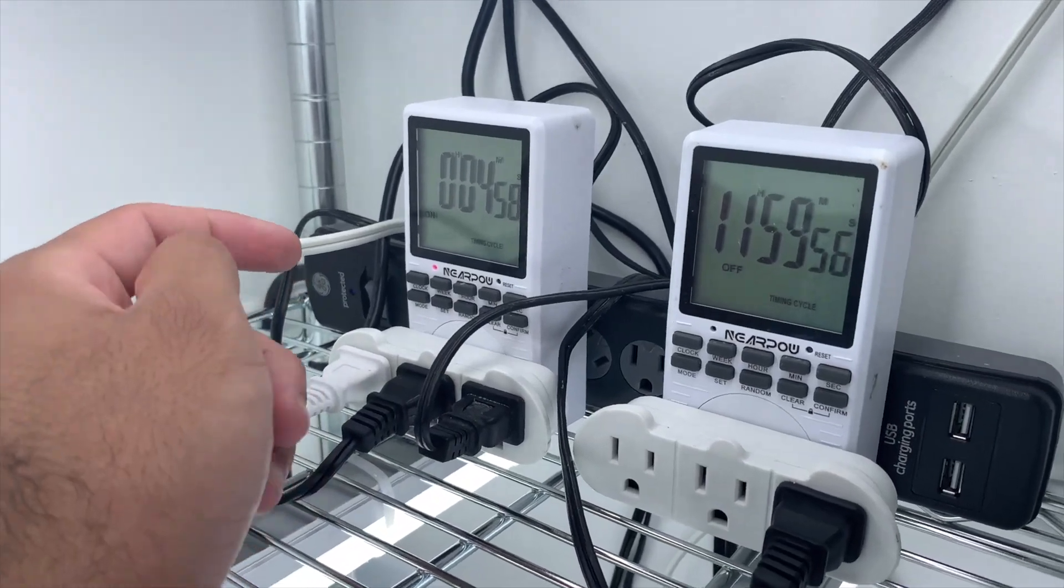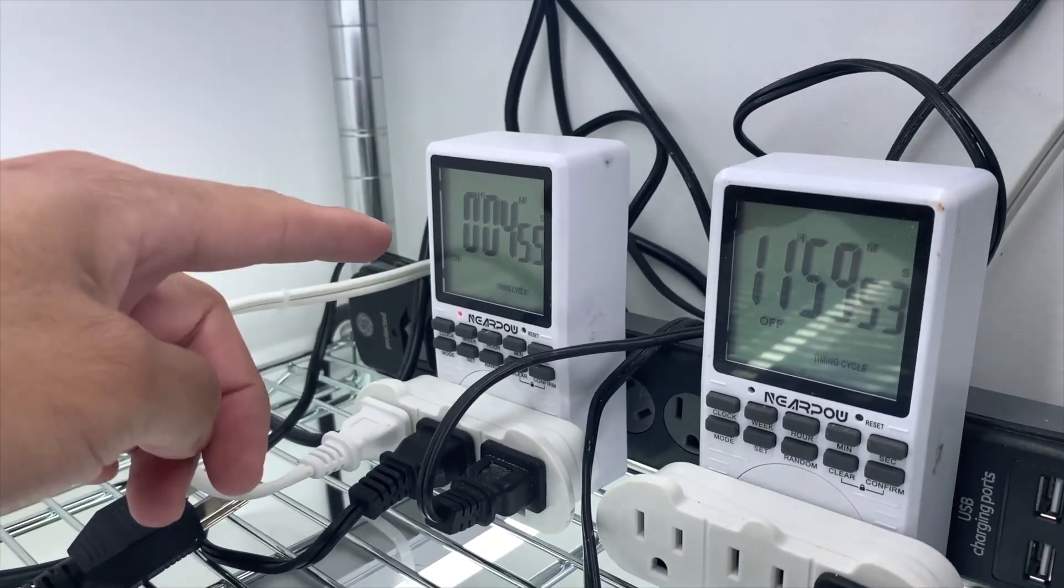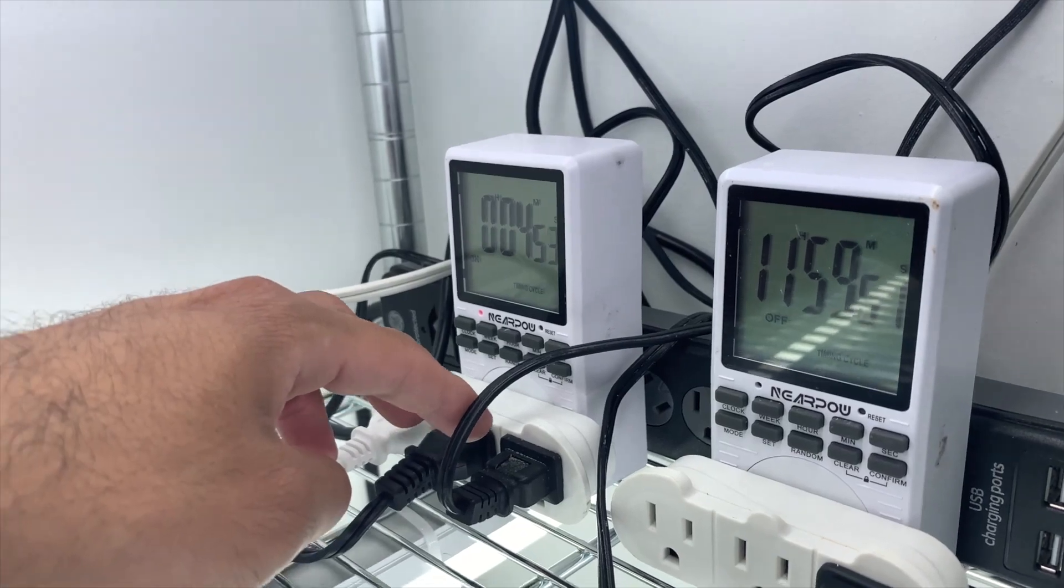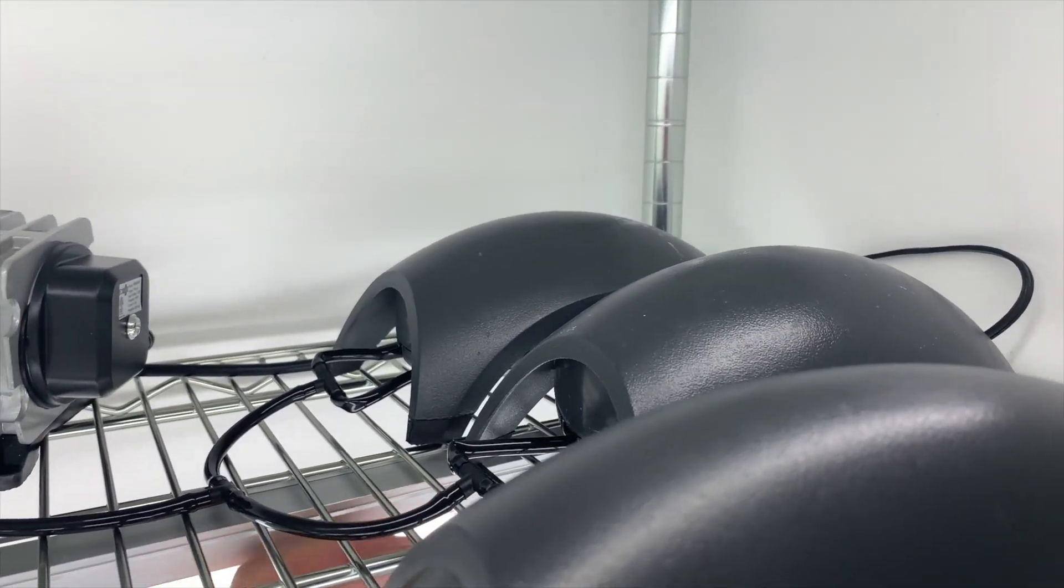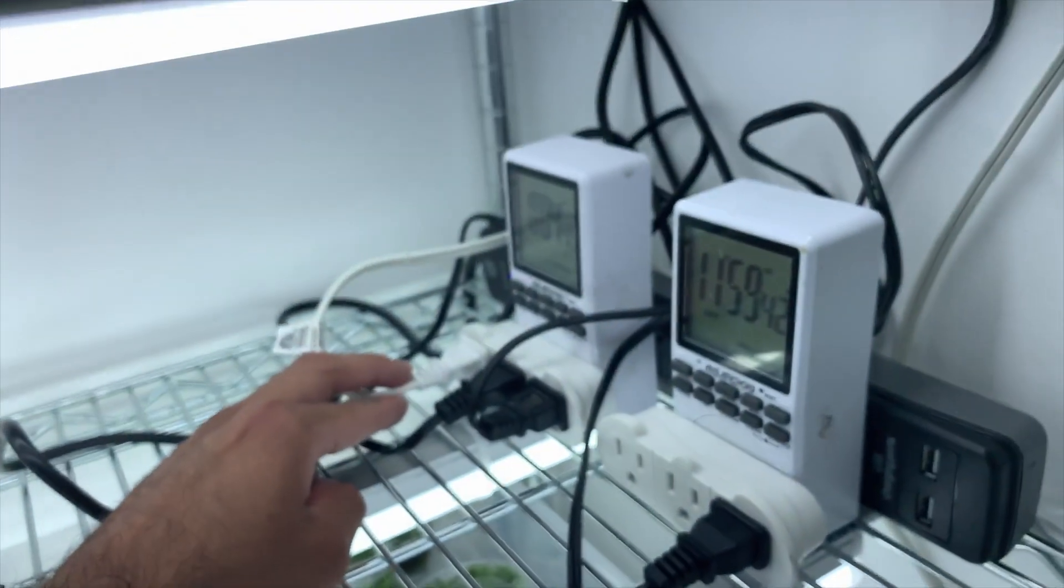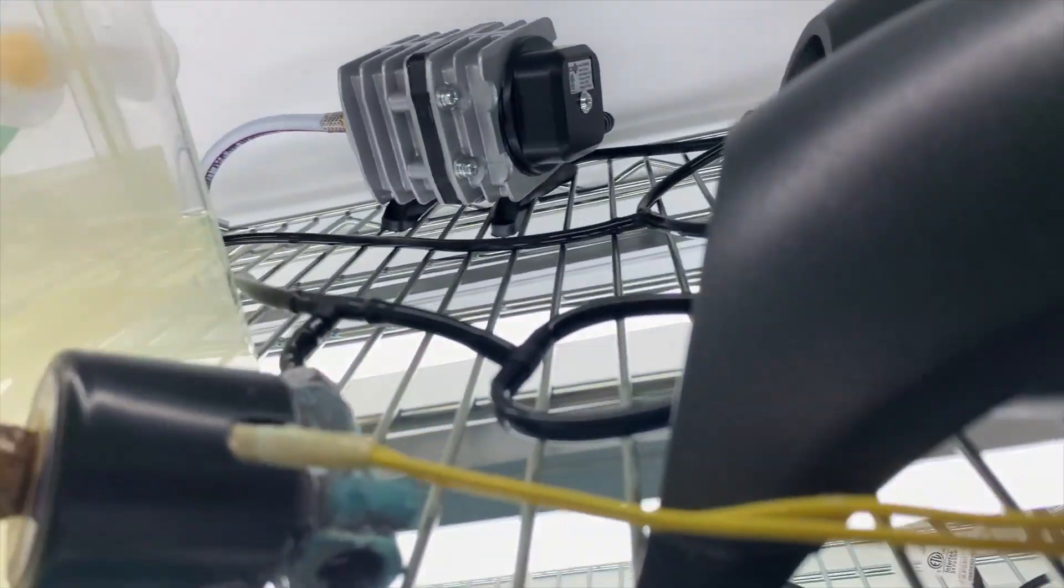Now the other timer is on, which powers the other two aquarium pumps, the other one in the back, and also powers the solenoid.